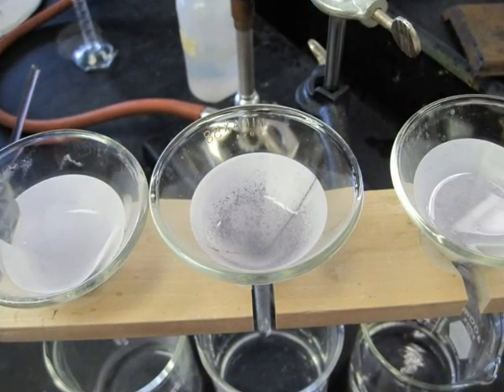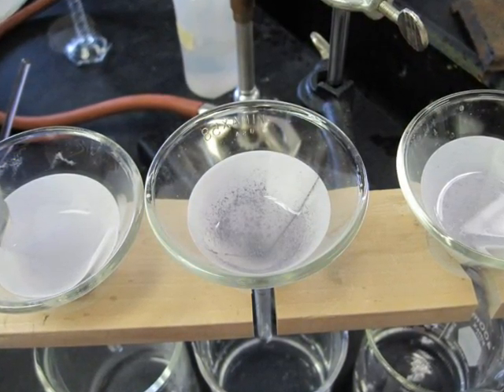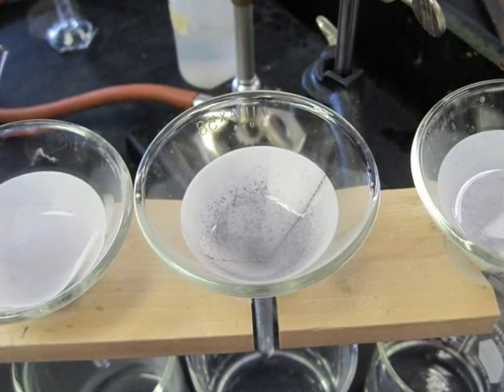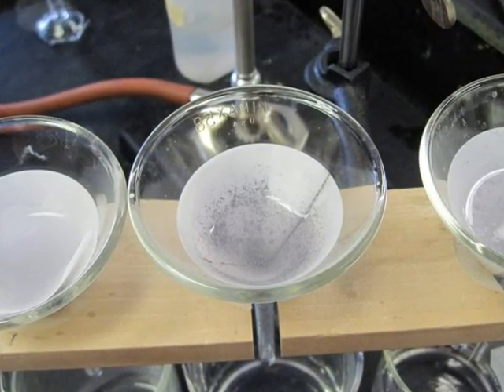When filtering is complete, wash the precipitate twice with distilled water. Perform a final rinse with acetone to aid in the drying process.